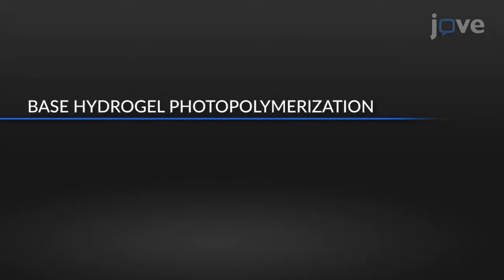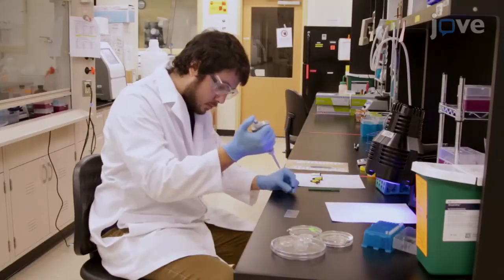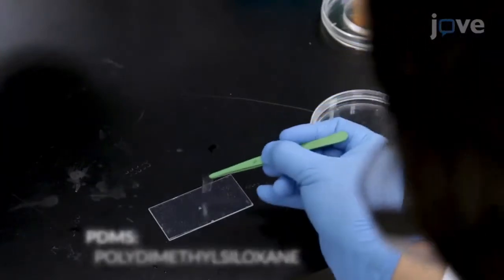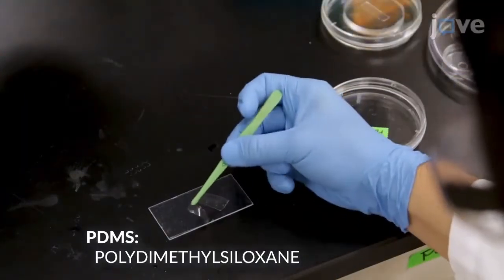For photopolymerization of the base hydrogel, first add 3 microliters of the pre-polymer solution onto a thin flat sheet of perfluoroalkoxy alkanes, and place flat 150 micrometer thick PDMS strips surrounding but not in contact with the drop of pre-polymer solution.